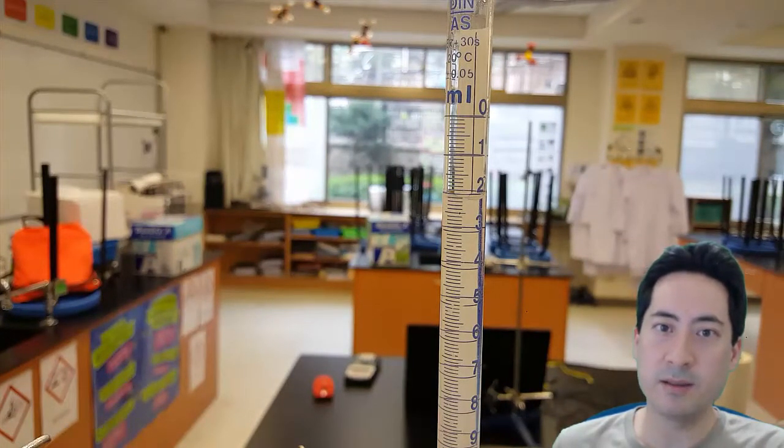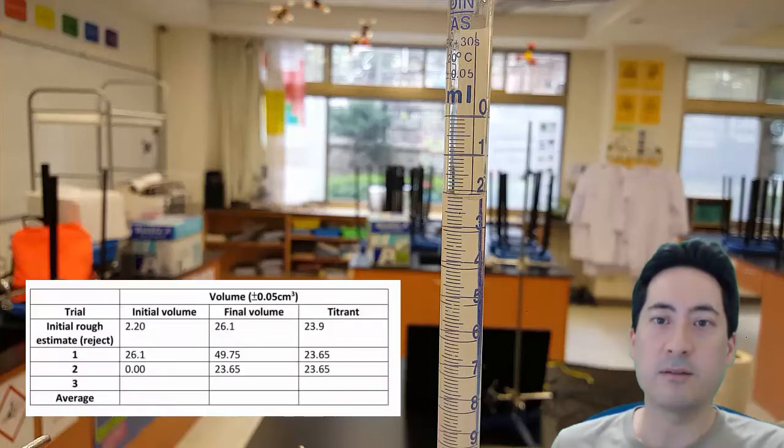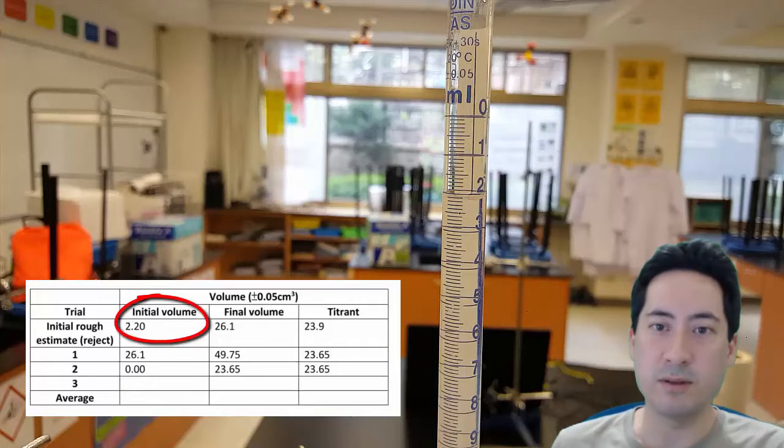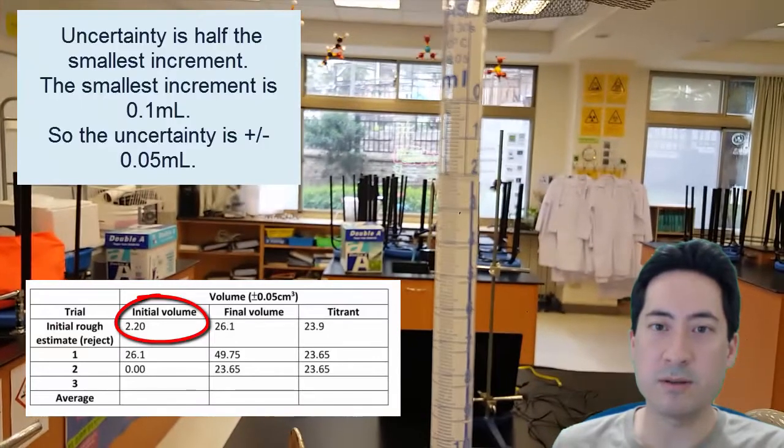And here you can see I'm ready to start. And I can take a meniscus reading there. And I can write that down as 2.20.